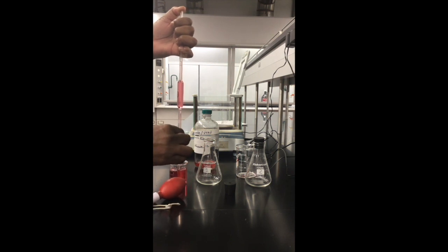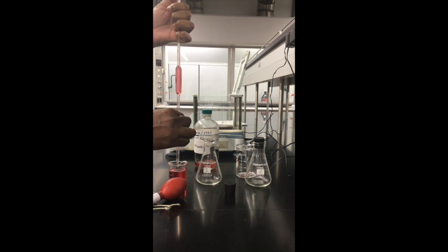I'm just gonna control the meniscus until I have it just by the calibration mark right there.